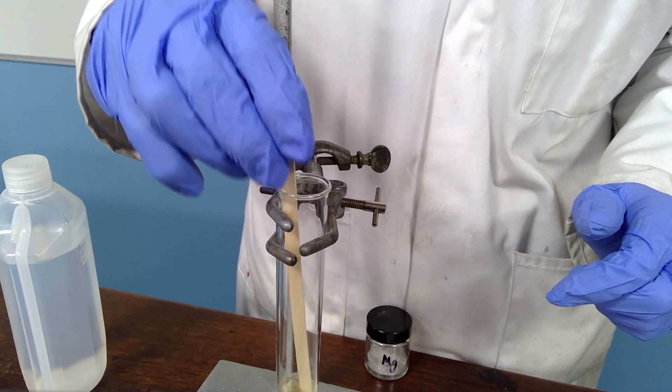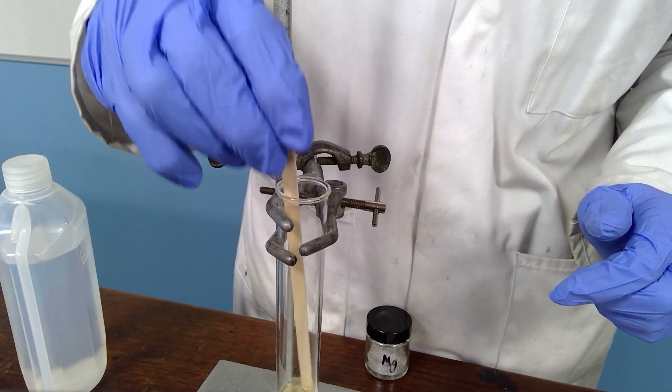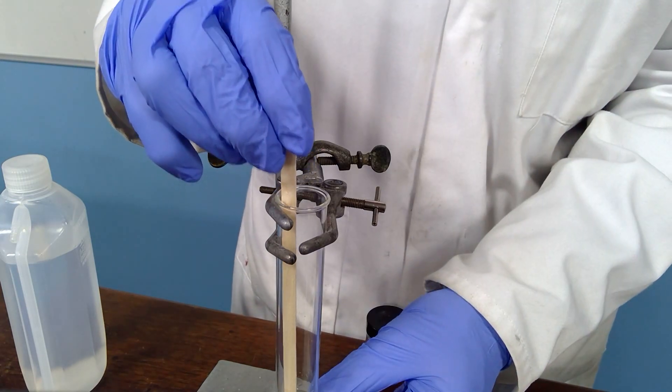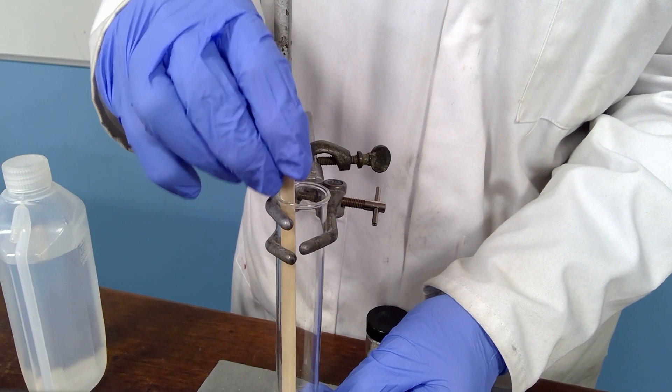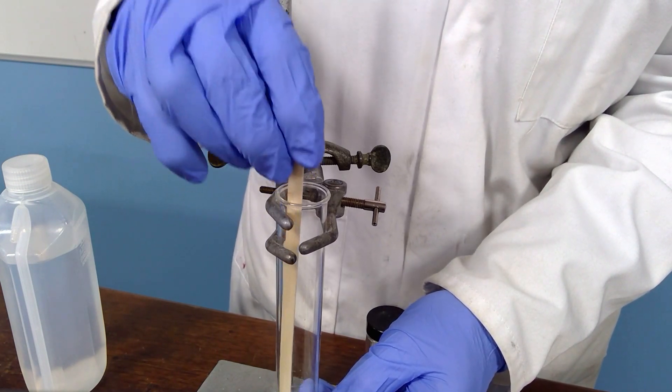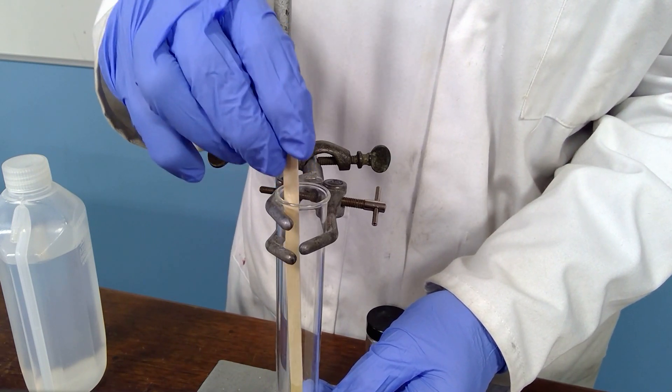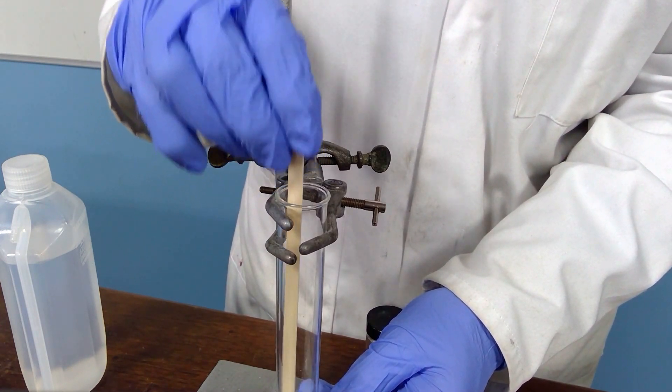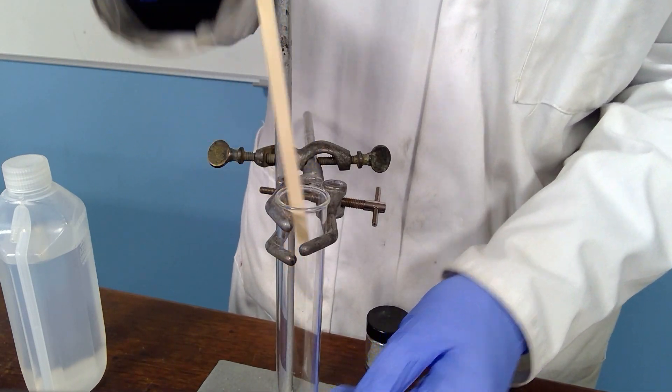It is best to have the glass wool completely soaked with water but with no spare water which can run onto the magnesium. That seems to be about the right amount there, doesn't seem to be any residual water present.